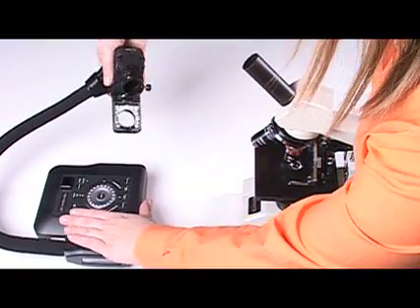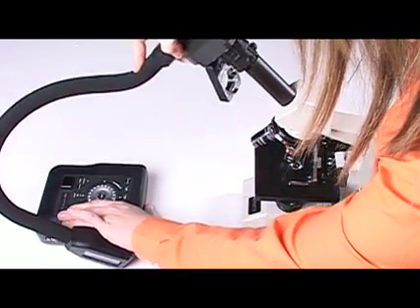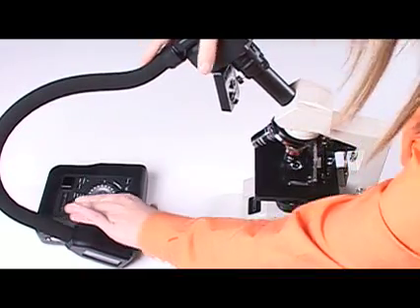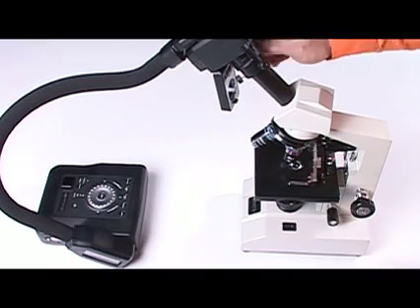Be sure your microscope is powered on and focused. Then connect the eyepiece to the coupling on the adapter and tighten the screws on the side to secure it into place.